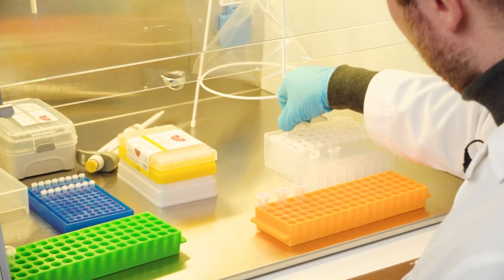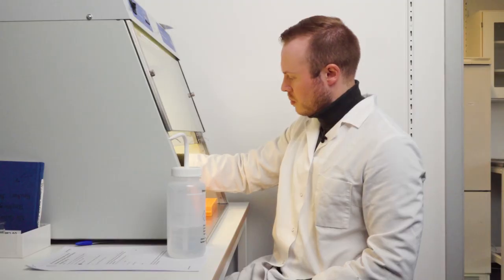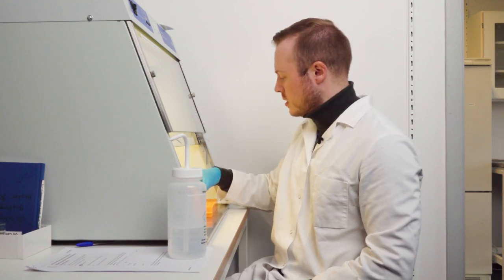And I like to have a little bit of space between them if I have the opportunity, because it makes it way easier to open the lids with one hand.